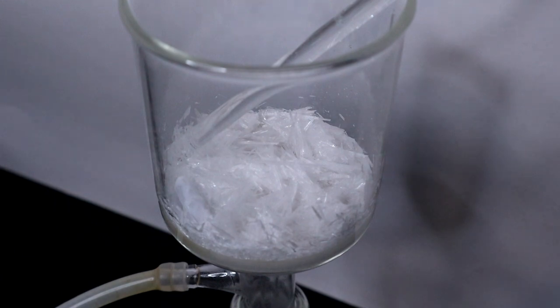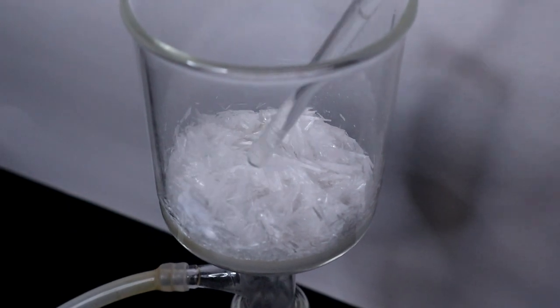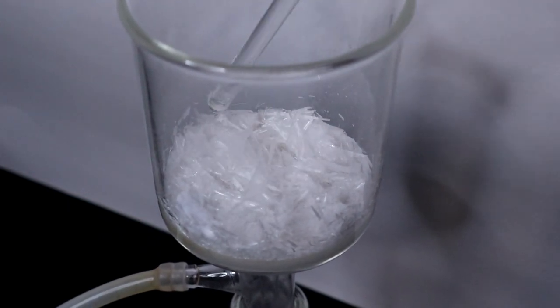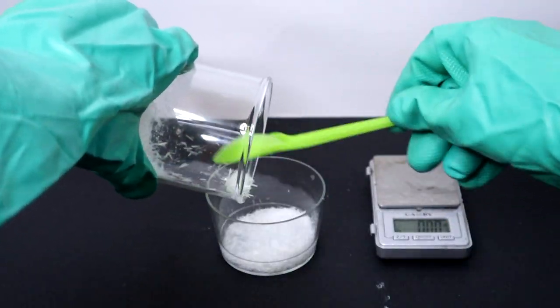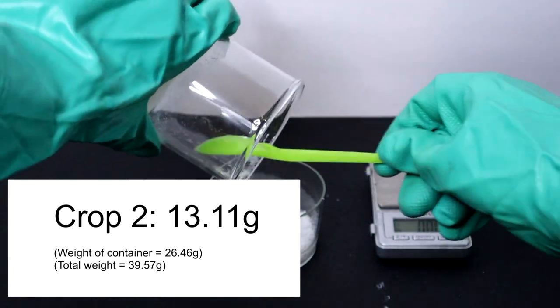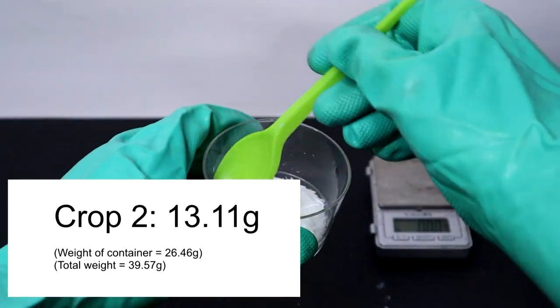As before, these crystals were then filtered and allowed to dry on the hot plate. The second crop of crystals yielded 13.11 grams of extra-pure hydroxylamine hydrochloride.